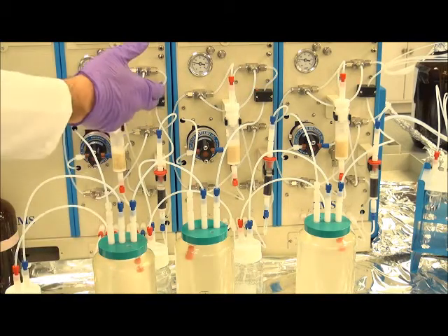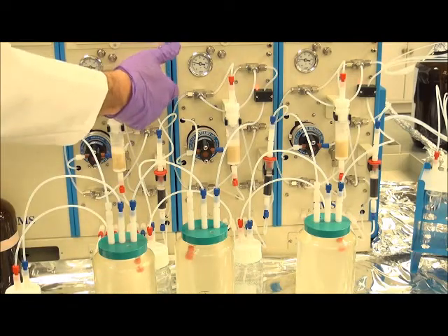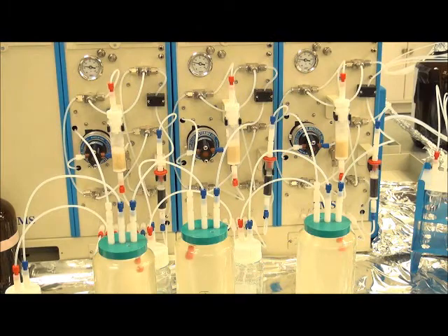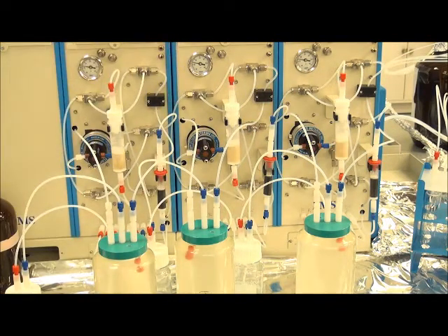At this time, the sample valves open, the vacuum pump kicks on, and as the vacuum builds, sample begins to draw across the bubble sensors, at which time they will go off until there is no more sample passing across them, and they will close the valves to terminate sample loading.